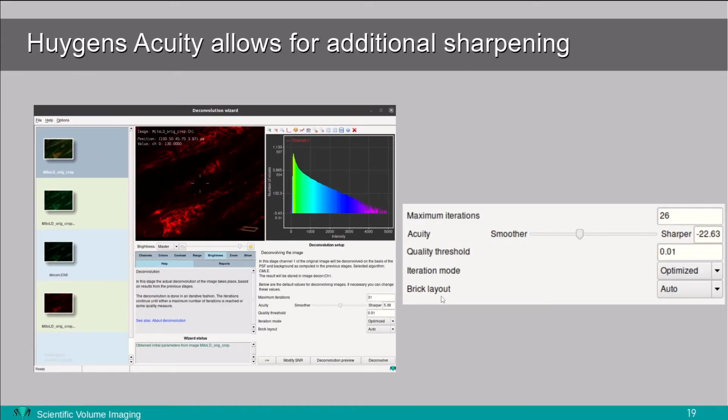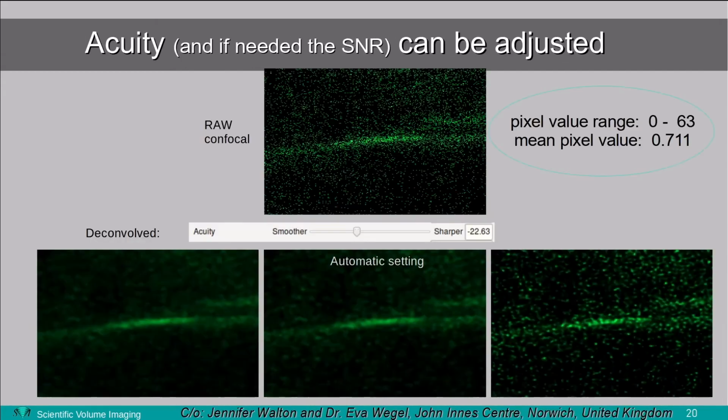You can further smoothen and sharpen the image. You can overrule the setting of the SNR value if you like to, but the Acuity setting on a good acquired image should do the job. So here an example of that. This is a raw confocal data set from a Leica microscope. It has a pixel range value from 0 to 63, so not a lot of photons captured. The mean pixel value is 0.7.